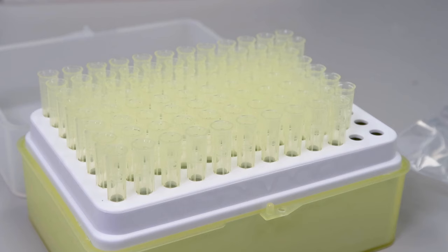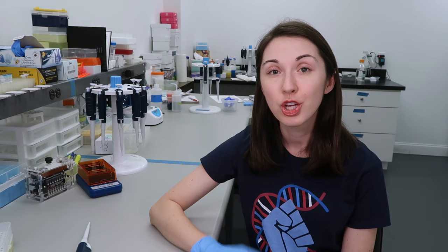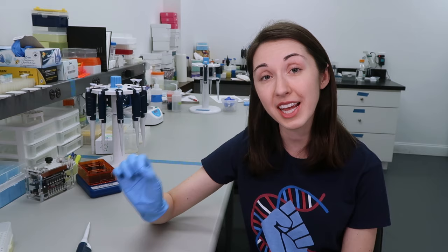Once you have set the volume on your pipet, you will need to add a pipet tip. Tips prevent liquid from entering the main body of the pipet, keeping it clean. You should change tips every time you pipet a new sample or reagent in order to prevent contamination.